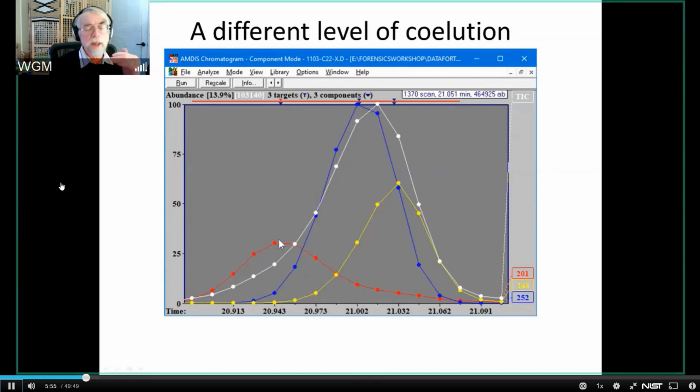And we know they're distinct because the ions are rising and falling at different times. And as Ed discussed in the previous talk, the way AMDIS works is that it looks for these ions that are rising and falling, and it says what other ions are rising and falling at the same time. It finds the ions that peak at this time, and it associates them. It finds the ions that peak at this time and associates them, and then looks to see if the shapes are right. And from that, it generates a spectrum.